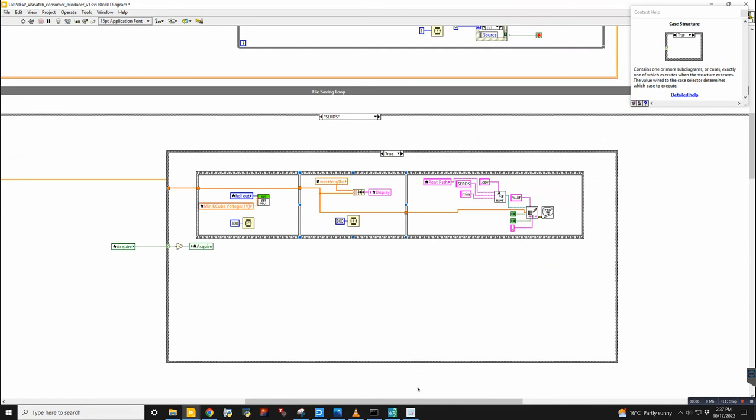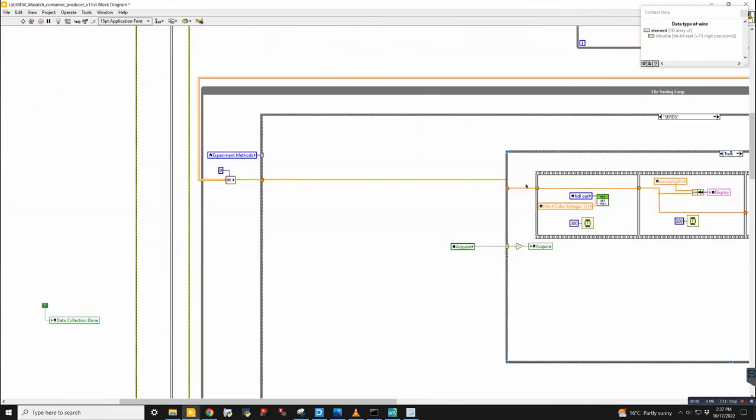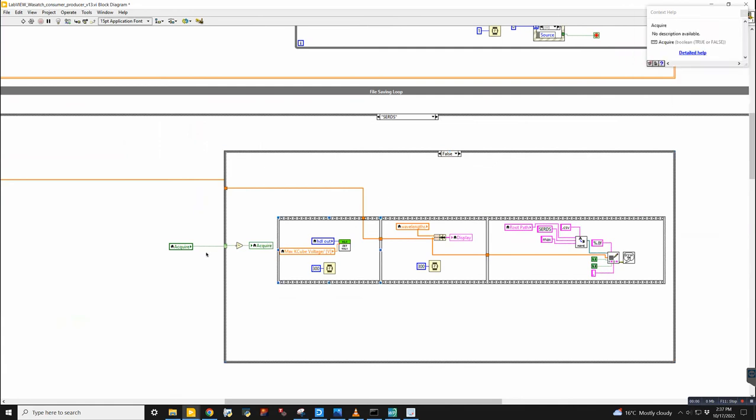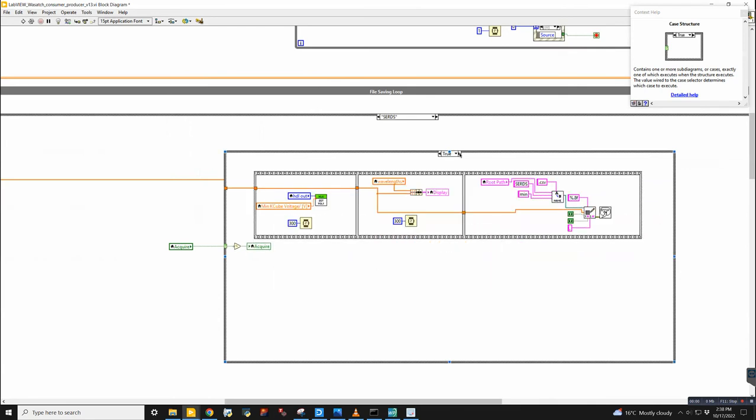The next one is SERDS. This one actually takes data from this channel writer. So we come in here. First thing that we do is, yeah, I see how this works. I like this. Okay, so you click, if acquire is hold on, how does this work? You click max, min. So the data is streamed in here, and then you set the minimum voltage, and then over here, the spectrum is put into a file.